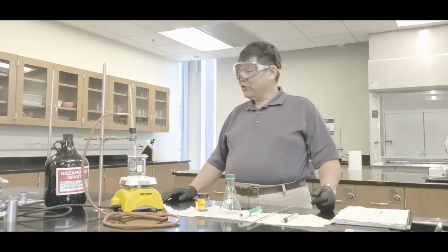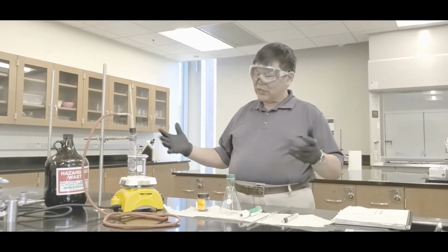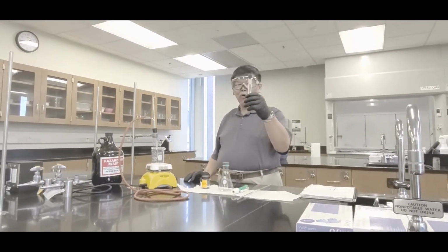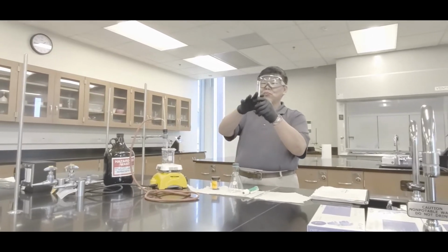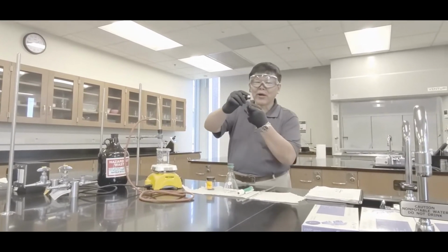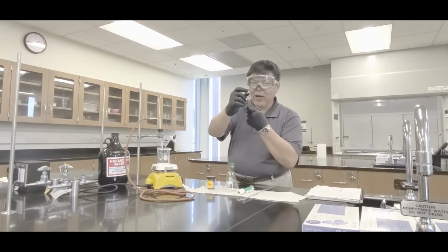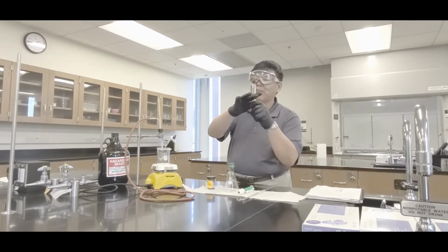All right, class, here's the equipment that we're going to be using. These are the equipment and the samples. First thing is to go over and grab a sample. The sample is a test tube with a black cap, and there's a number on it. Make sure you write down that number on your lab report, okay? Your teacher will know the identity and will compare.